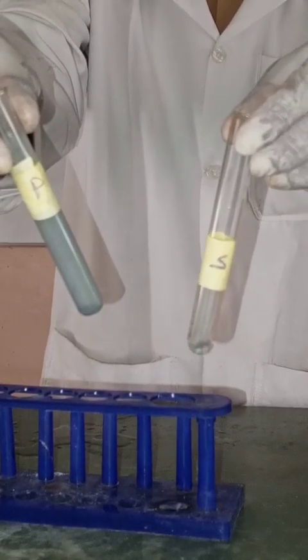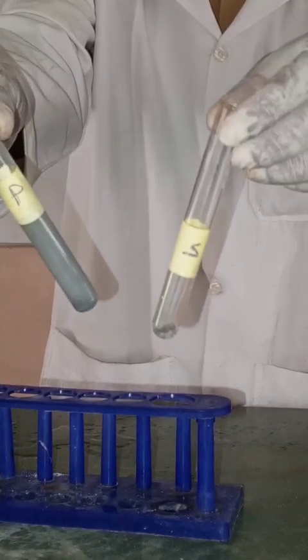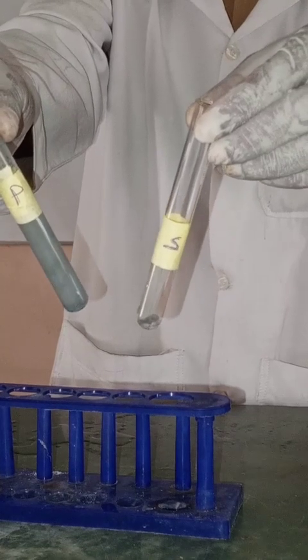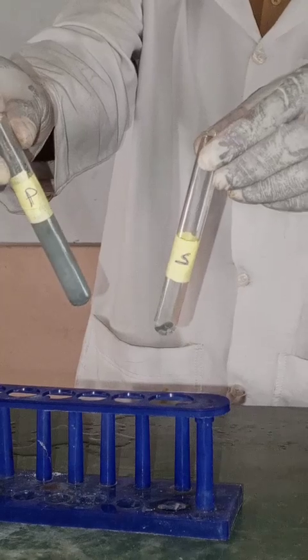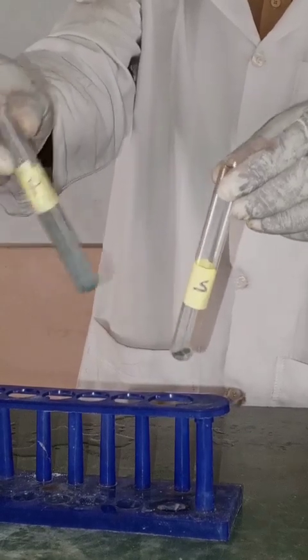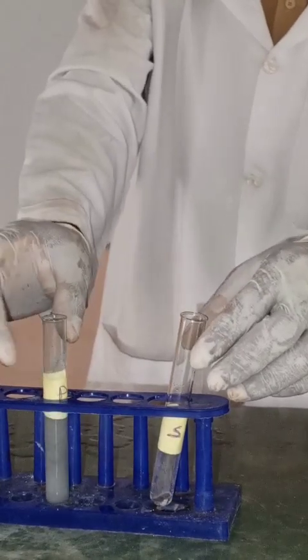Which one is faster? You can see the reaction. When zinc solid reacts or zinc reacts with acid, it releases hydrogen gas, which is very explosive. You can test hydrogen gas with the pop sound.